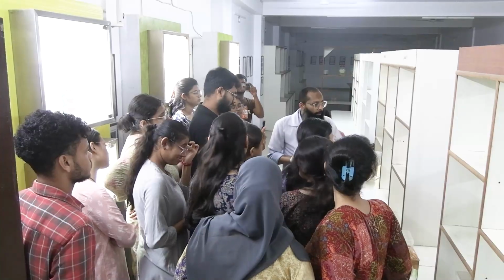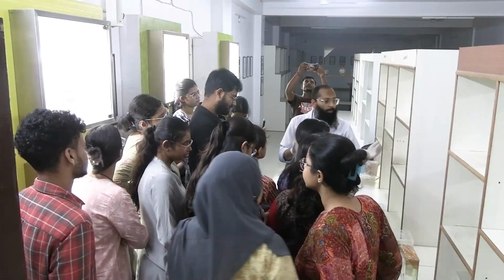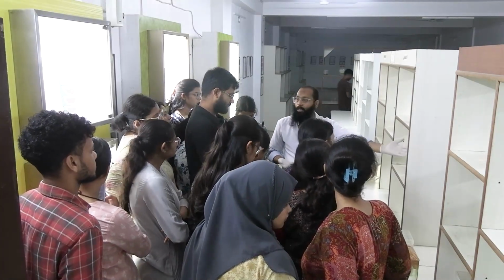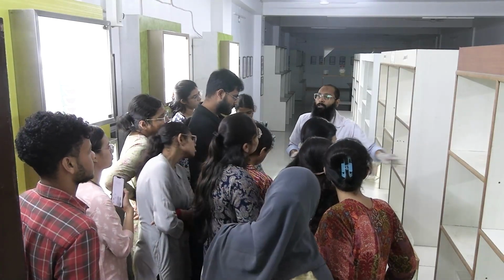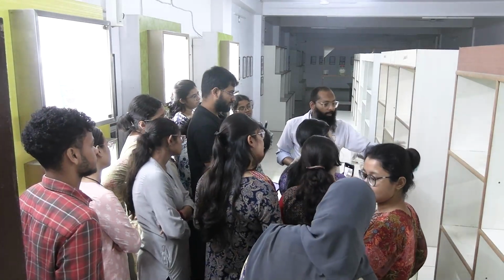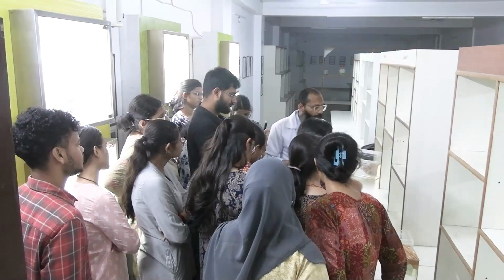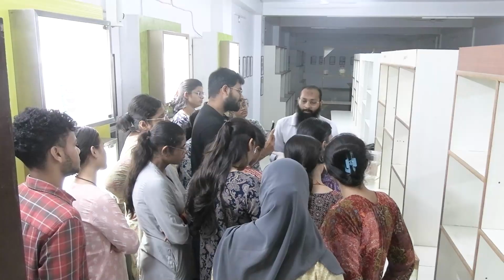So the normal gross picture of the breast is a greasy or yellowish appearance, because it is mainly formed by adipose tissue, which looks yellowish. But this whitish area is an abnormal thing. Second, this is solid, not sponge-like or soft. You can say there is a whitish solid area noted just below the nipple-areola complex. You can describe it in this way.